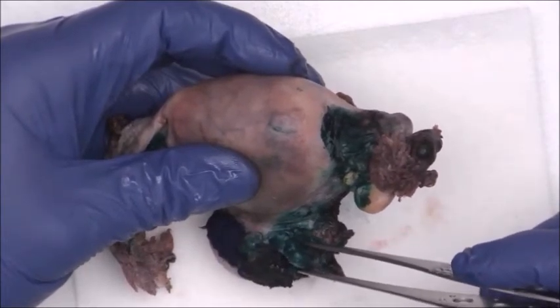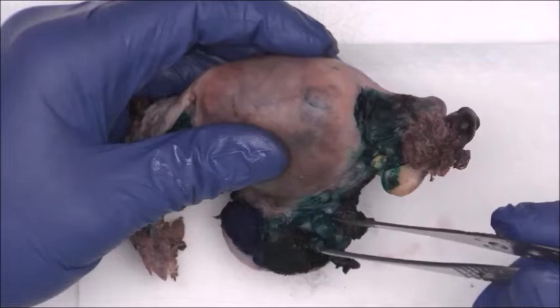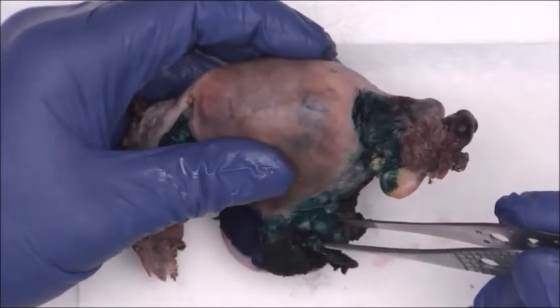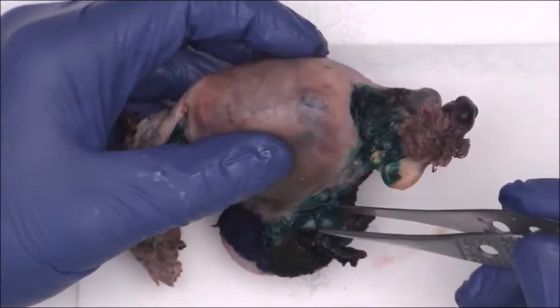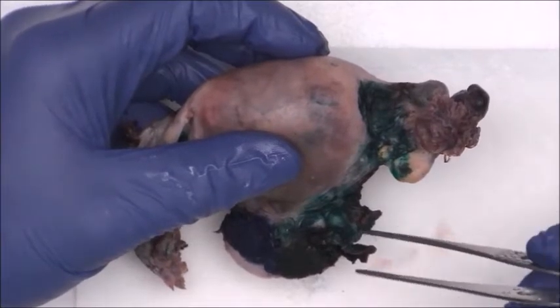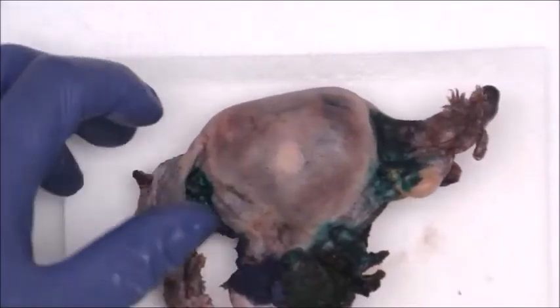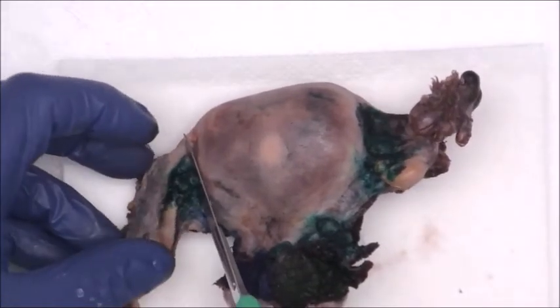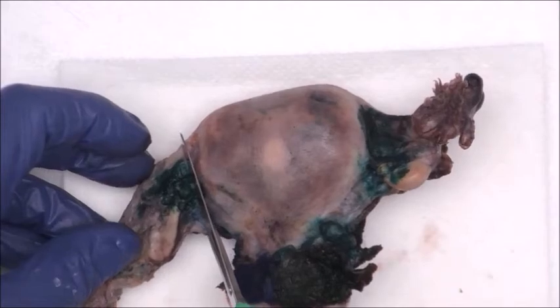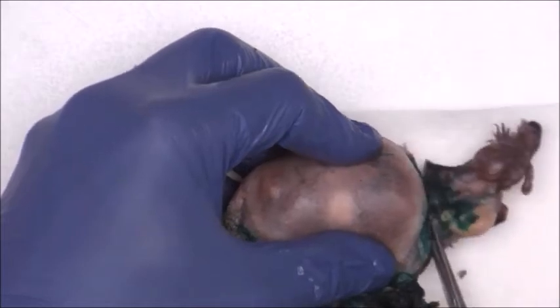And the reason I did is because the pathologist is going to want to see, are these truly on the outside and not within the ovary or within the tube, those types of things. But it's pretty obvious that these are tumor excrescences outside the uterus, and we do know that this is a cancer that's not involving the cervix, nor the endometrium, nor the adnexal structures, so that kind of makes sense. So depending on how you do it in your practice, we have a template we use, and we always talk about the uterus first and then the adnexal structures next. So I'm going to go ahead and cut off and divide the left and right adnexal structures and concentrate now on the uterus.